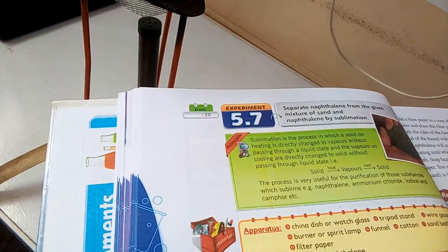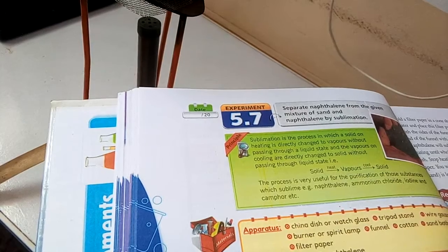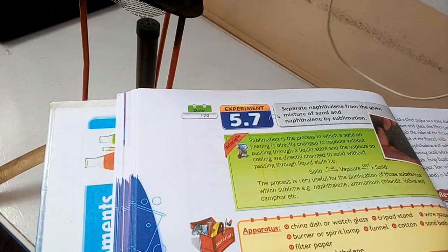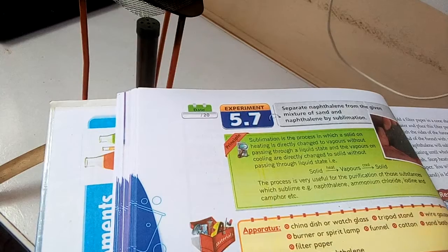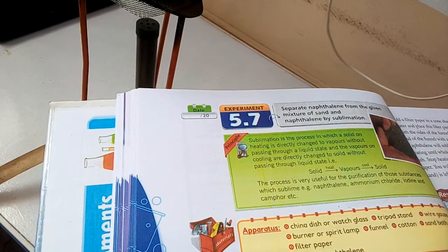Assalamualaikum dear students, today we will perform experiment number 5.7: Separate naphthalene from the given mixture of sand and naphthalene by sublimation.